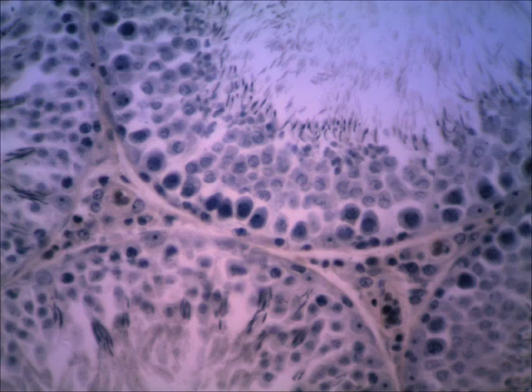Now this is a slide on high power magnification, and I'm just going to draw a blue line through the depths of germinal epithelium. At the base of that line, let's put some arrows on it. These cells are the ones that are the spermatogonia, which in lab you don't have to name these individual cells. I'm just giving you a heads up on your lecture. But those are the spermatogonia, and those are the ones that will divide through mitosis and enlarge to produce the primary spermatocytes, which is what you see right here.